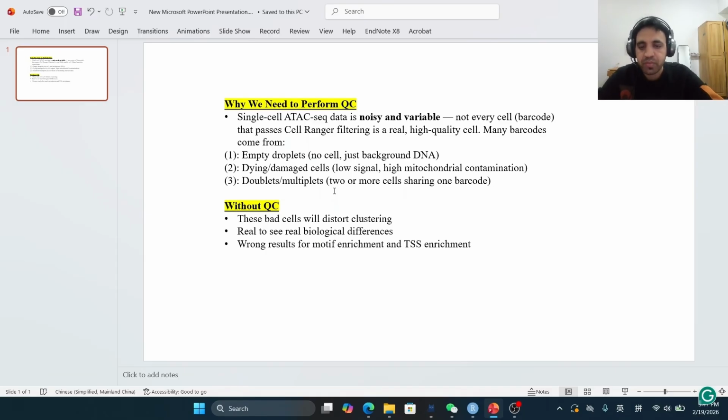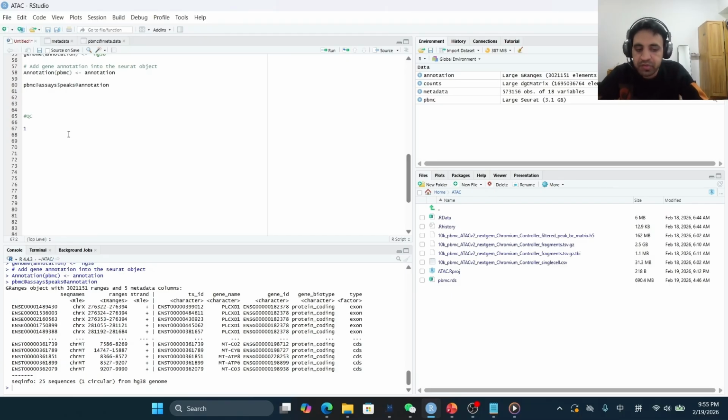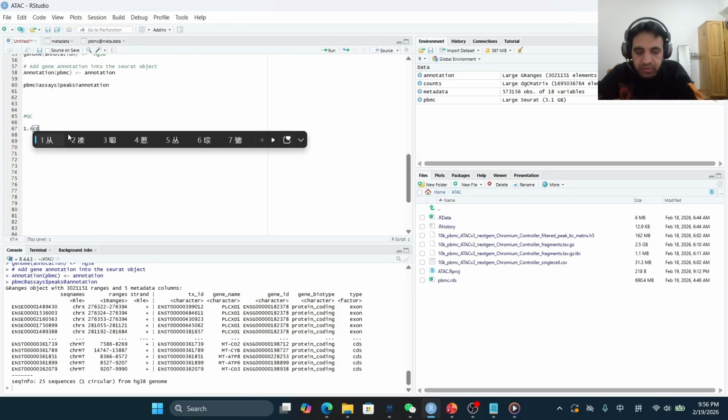If we do not perform the quality control, then these bad or low quality cells can disturb the clustering, and similarly we will not be able to see the real biological differences, and it will lead to the wrong results for the motif enrichment and transcription start site enrichment analysis, and that is why we need to perform the quality control. Now let's get started with the quality control. So first of all, we will compute the nucleosome signal for each cell.